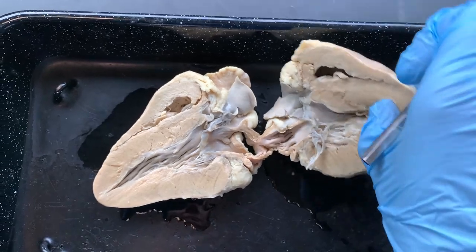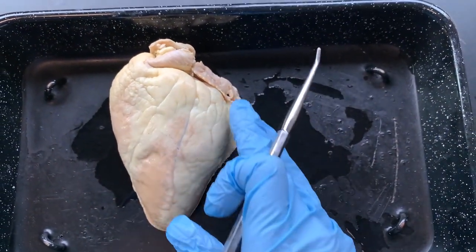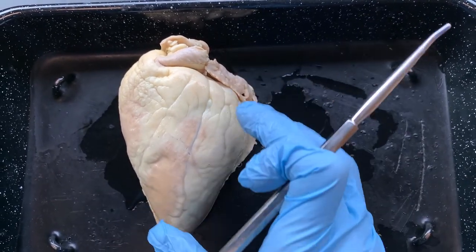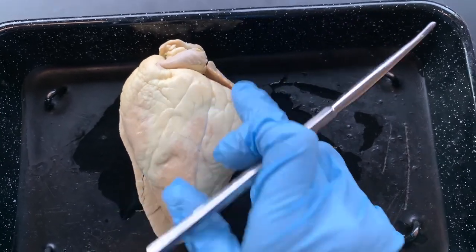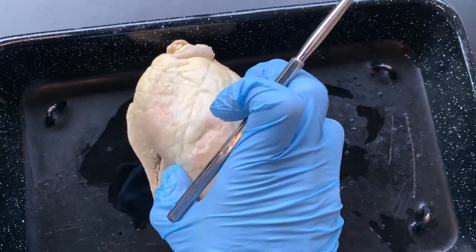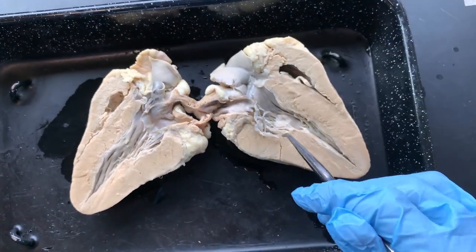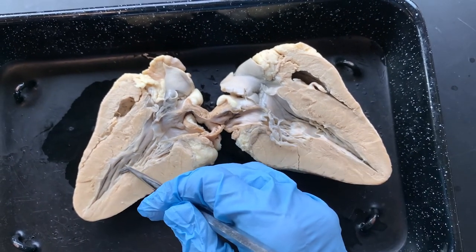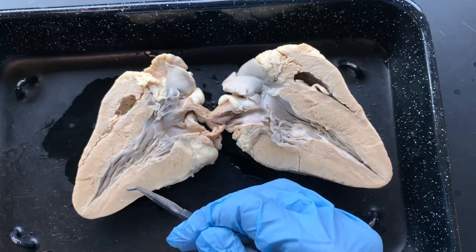Let's do that with the left side. This large area here is the left side. We know the left side is much larger because it has to pump to the body, to the brain, especially against gravity. Here's the left side — much bigger. The muscle is much bigger on the left side.